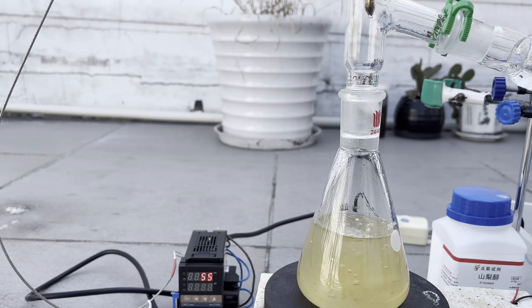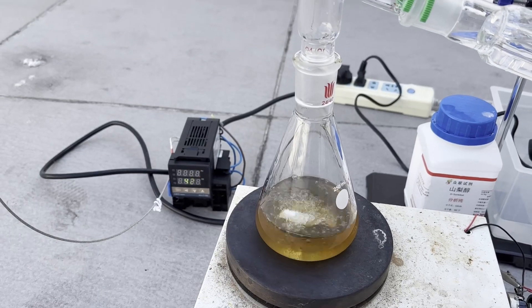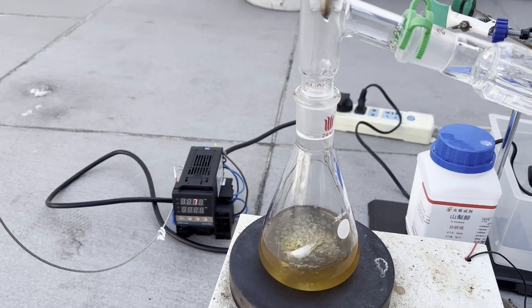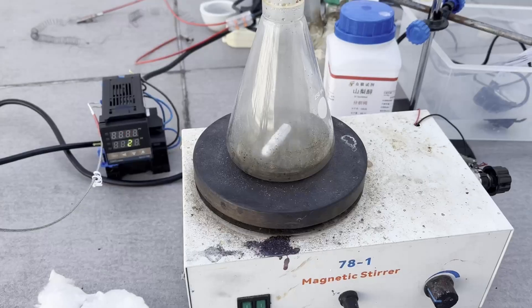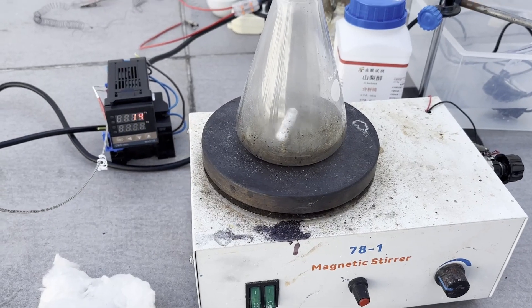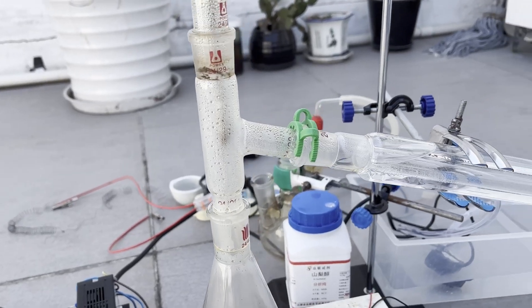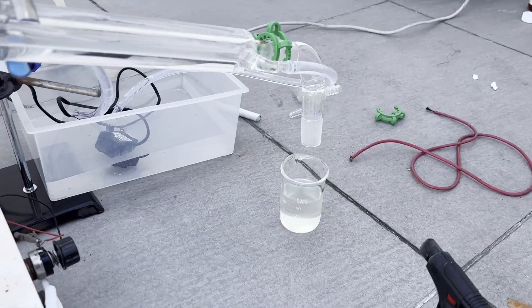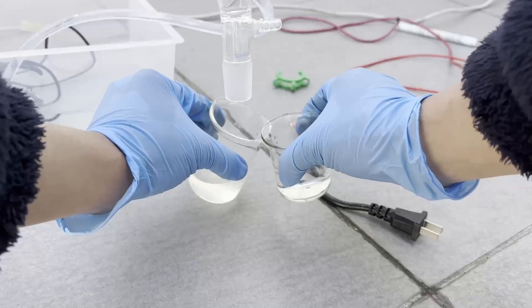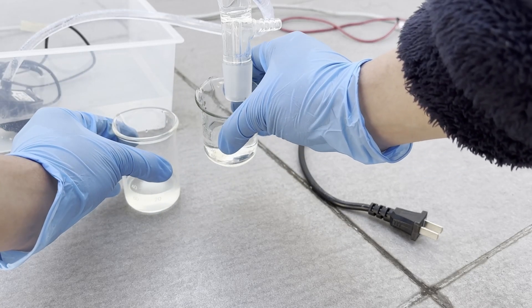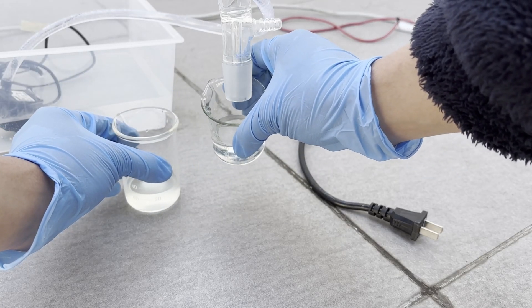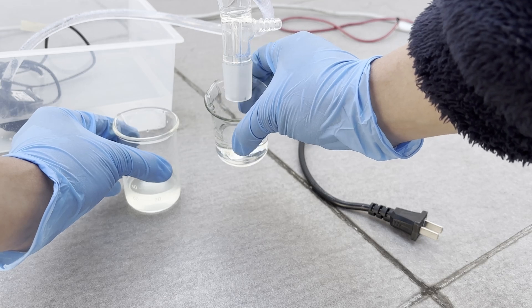Initially, lots of acetone boiled over at around 55 C, which was expected, but I was worried when liquids still continue to distill at a temperature well past the boiling point of acetone. Nearly all the liquids distilled below 110 C, and all that's left in the flask is a bunch of tar, which tells me that the reaction definitely didn't work and no acetic anhydride was produced. I have no idea what this liquid is. It was heavier than water and soluble in it, but it probably wasn't acetic acid, since their boiling points don't match up.